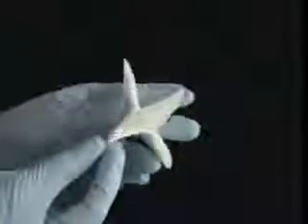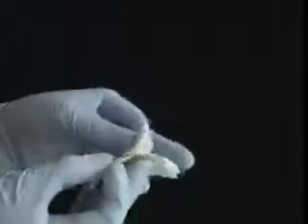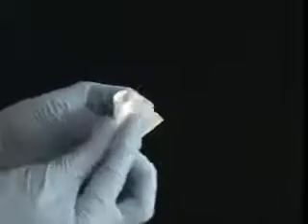Take one section and separate it from the rest. Push in the crease and fold back the little triangles that form. You want to do the same thing for the next 3 sections. Essentially, you're forming 2 little triangles from one big one. Like a mother giving birth to twins.